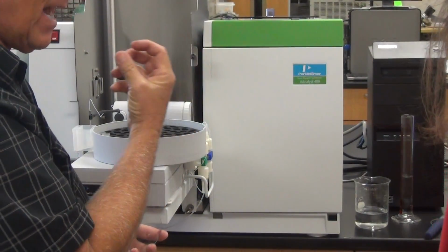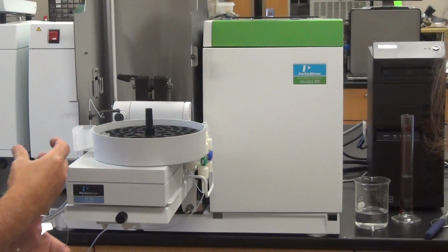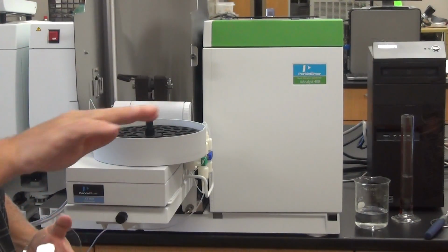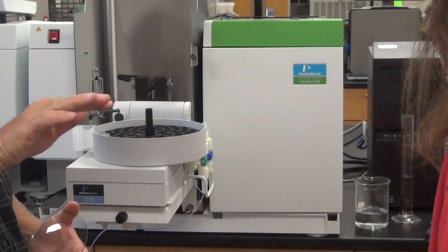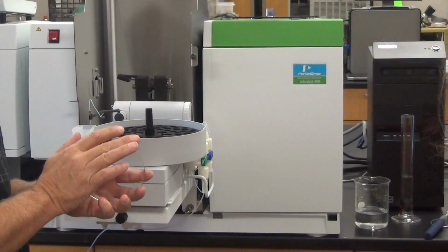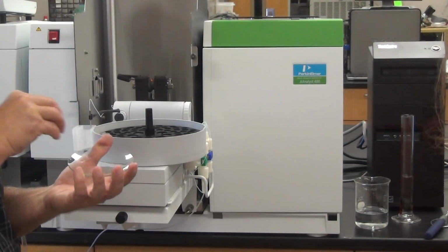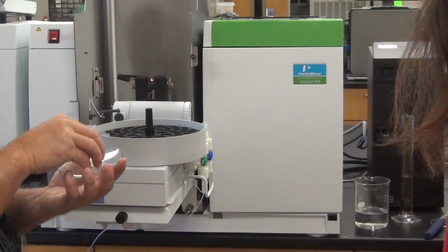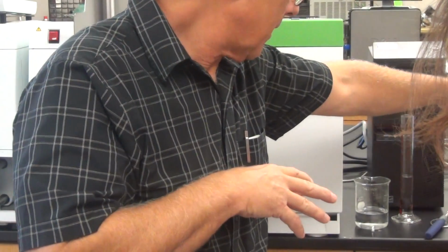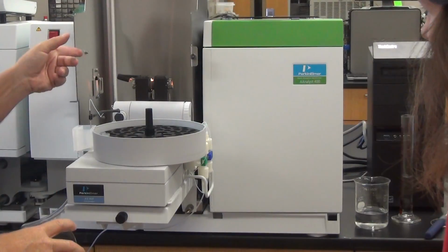Now, when we pyrolytically coat it, it means that we're coating it with methane under a heat treatment. Okay? And what it's there for is to take the graphite and make it less permeable. So it sits on top of it, rather than letting it soak into it. Well, after you've got 100 or so firings on it and you're using acid, it actually soaks down into it. So if you don't dry it good, it's going to blow microscopic pieces of it out. This is char.